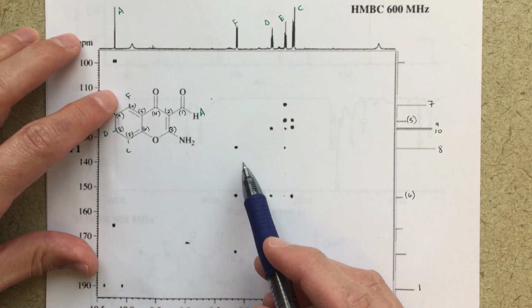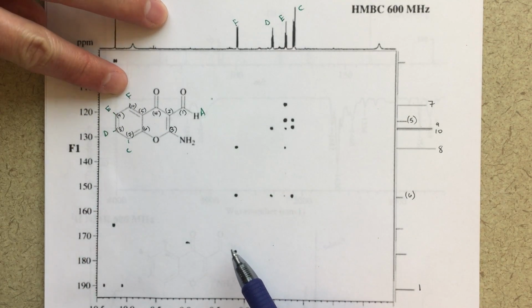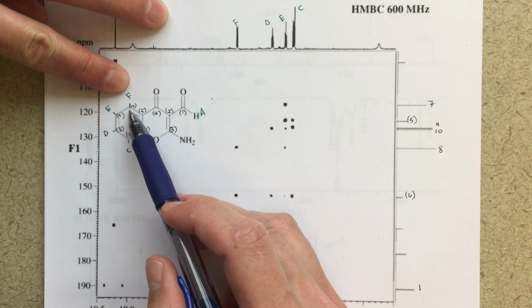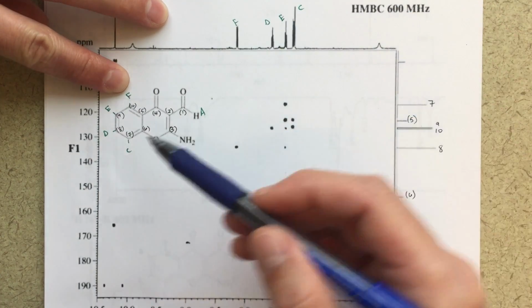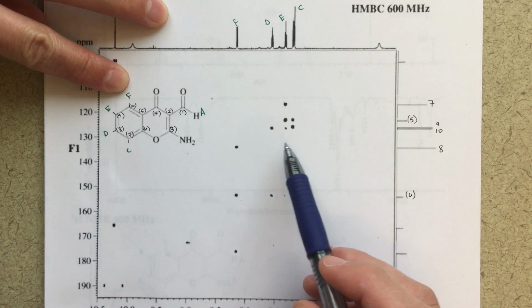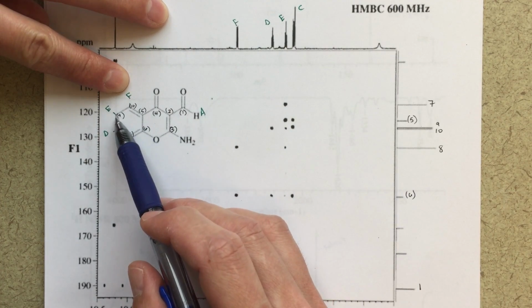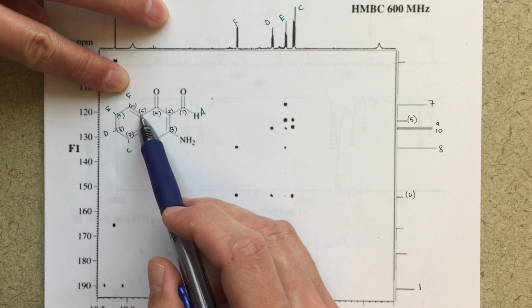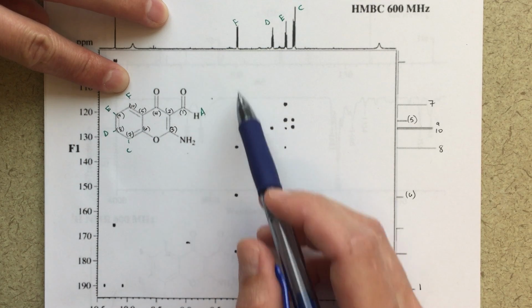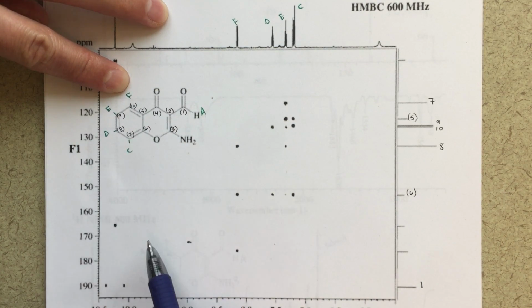Let's jump over here to F, because F's got 3 nice peaks that are sort of easier to follow. So if this is my F peak, I would count 1, 2, 3 in this direction first. So F should correlate strongly with proton at 8, and that's what we see here. F to 8, 1, 2, 3 bonds away. And then on the other side, 1, 2, 3 to 6. So F to 6, we see that. And then also 1, 2, 3, F to 4.